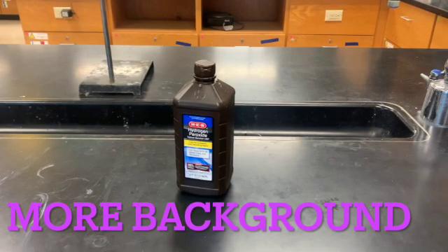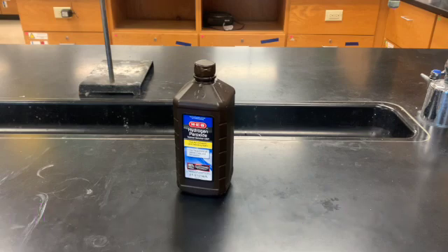More background. A number of catalysts can be used to speed up this reaction, including potassium iodide, manganese oxide, and the enzyme catalase. If you conduct the catalyzed decomposition of hydrogen peroxide in a closed vessel, you'll be able to determine the reaction rate as a function of the pressure increase in the vessel that's caused by the production of oxygen gas. If you vary the initial molar concentration of H2O2 solution, the rate law for the reaction can also be determined. Finally, by conducting the reaction at different temperatures, the activation energy, Ea, can be calculated.